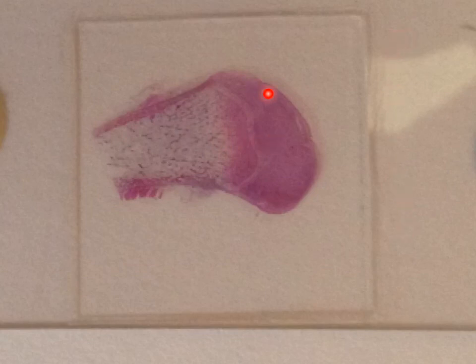However, it is formed of this area of the cartilage, taking the bluish coloration, and then we have this area where the ossification takes place, and finally we have an area of spongy bone inside the upper part of the diaphysis.